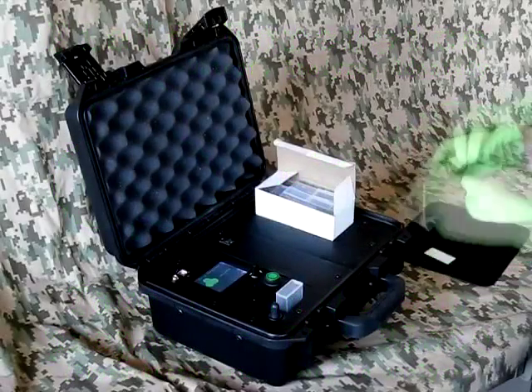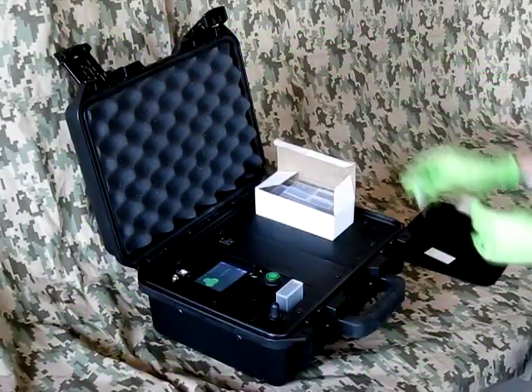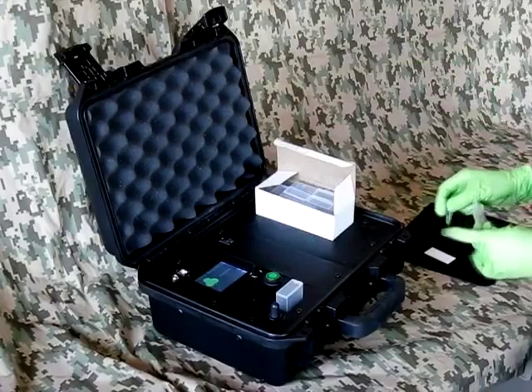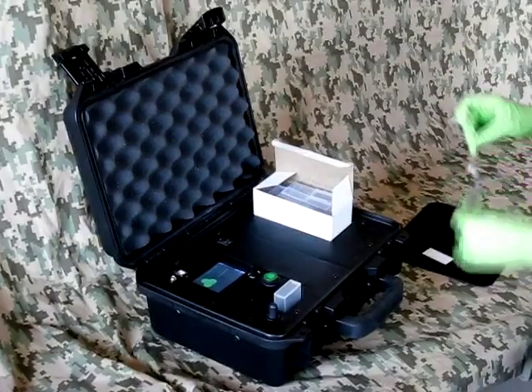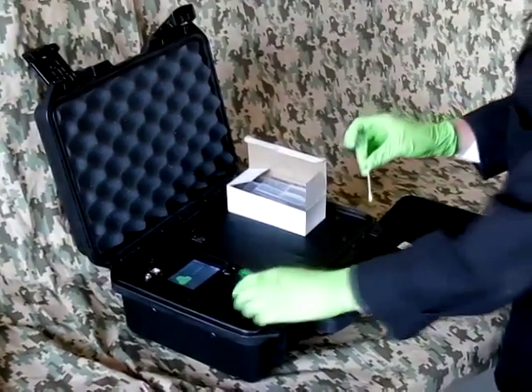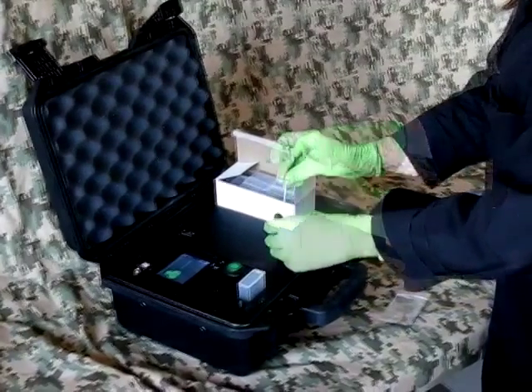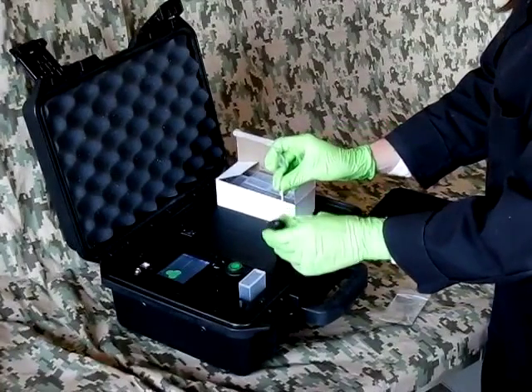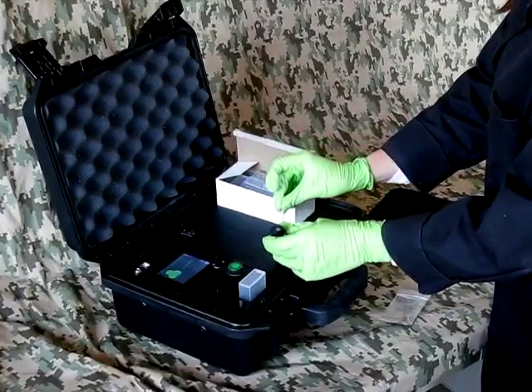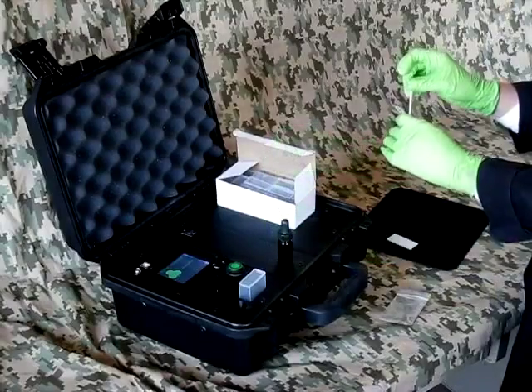Prepare your sample by first wetting the swab with acetonitrile. Swab your sample — in this case, it is soil suspected of containing TNT.